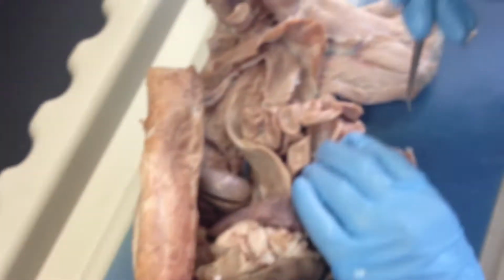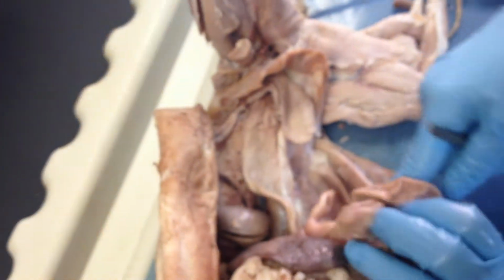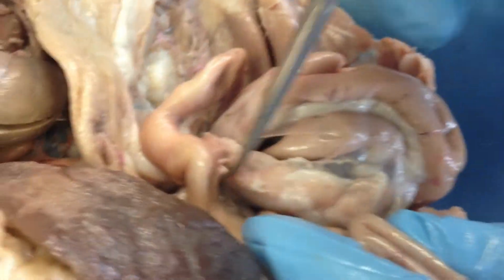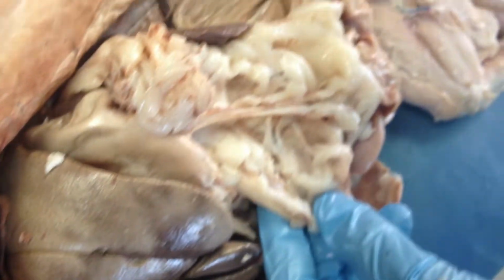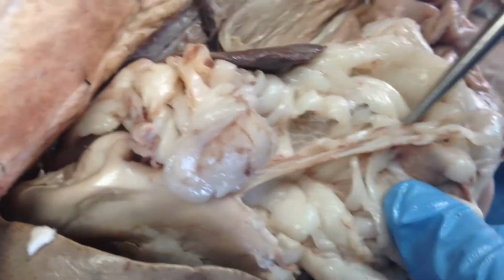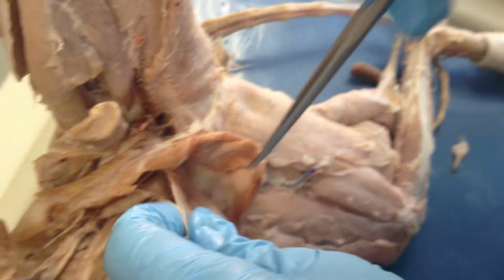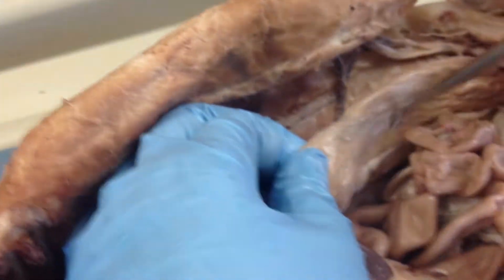We've got some mesenteric lymph nodes, but not in our greater omentum, rather in our intestines, but here they are. They're not always seen and not very well distinguished. Our greater omentum is this kind of hunk of fat connective tissue, and sometimes has mesenteric lymph nodes as well. The urinary bladder is here, and we'll look at it in a second on the other cat. The colon, also known as the large intestine, is this part.